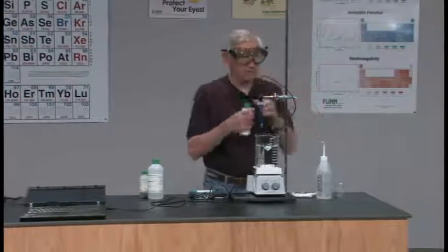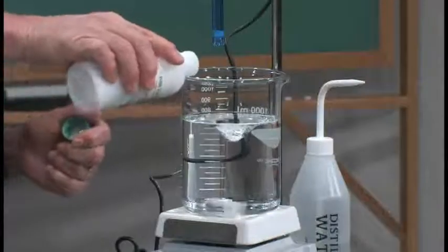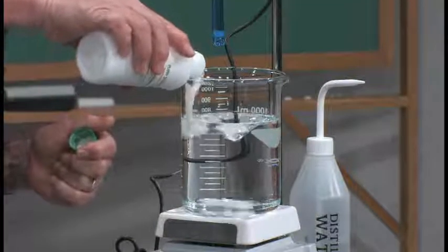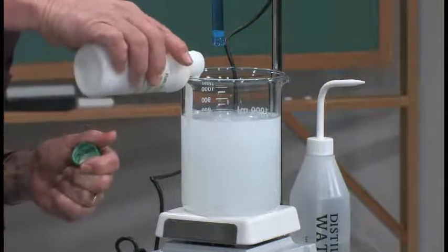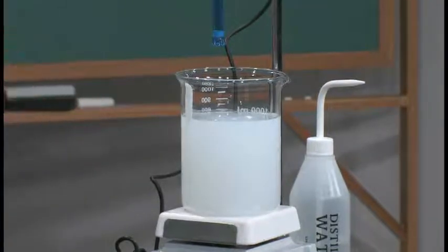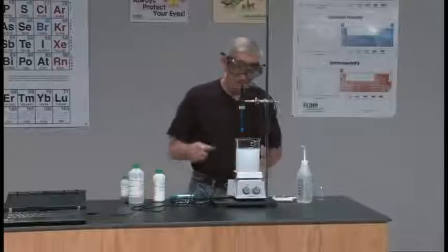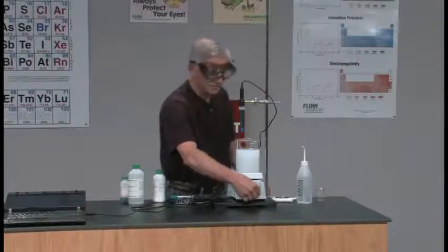I have calibrated goggles, so I'm going to measure exactly 22.37 milliliters of magnesium hydroxide in there. And kick up the stirring.